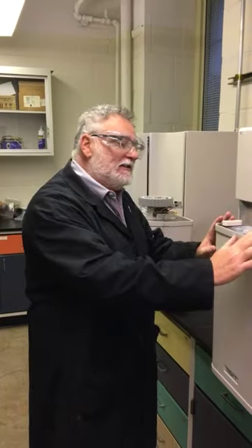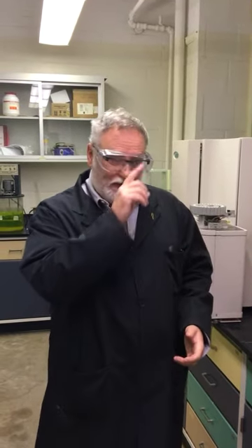I always tell you to wash your hands after the lab. We use catalysts sometimes in this space, and when we look at the risks or health implications of contamination with these catalysts, they are quite significant, so you need to wash your hands when you leave. This is why there's no gum chewing, so I don't want you being poisoned unless I've done it deliberately. So no food and drink in the lab for these reasons.